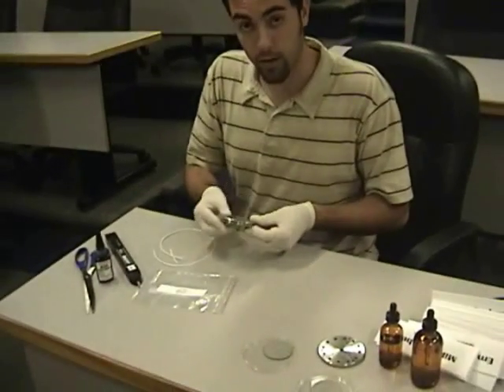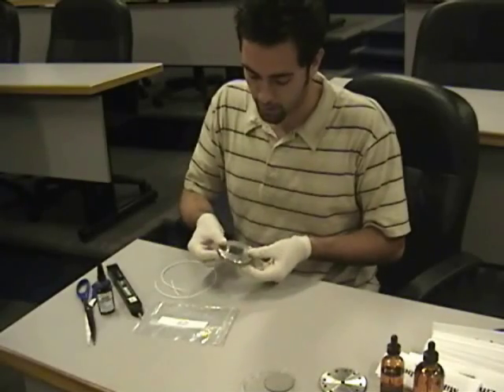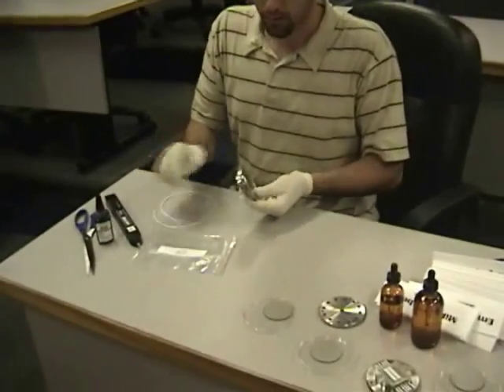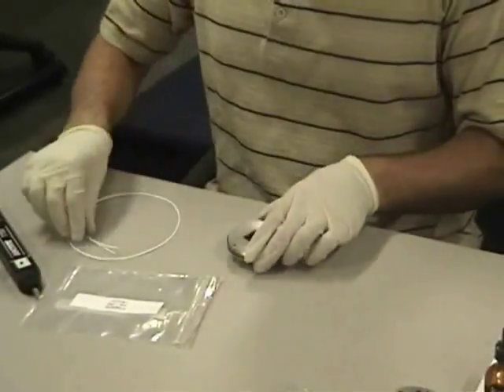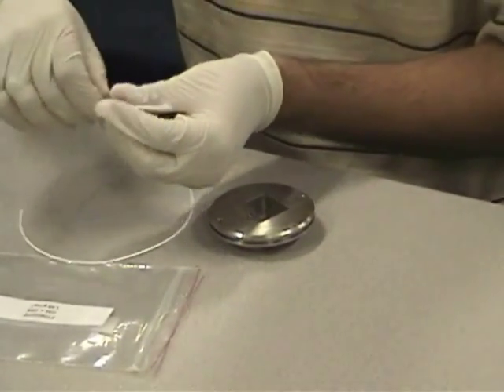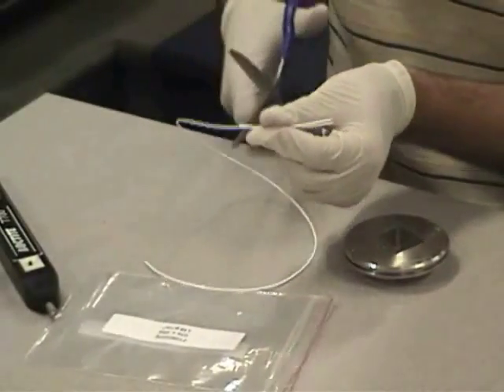This is to show you how to prepare a hollow fiber sample. You'll start with your plate and cut your sample to the size desired.